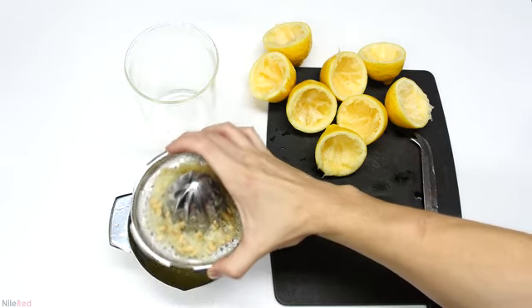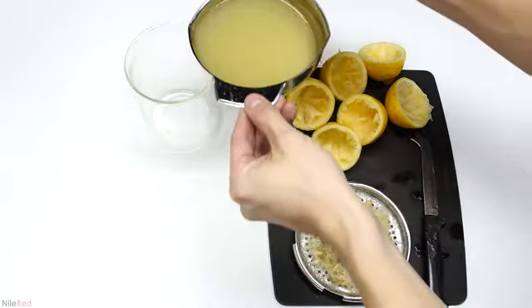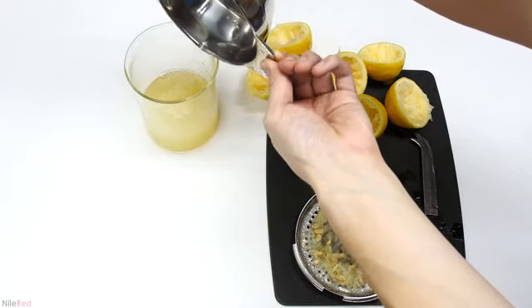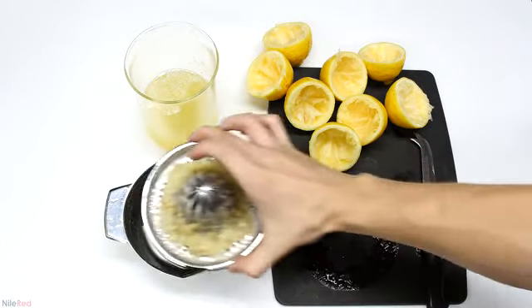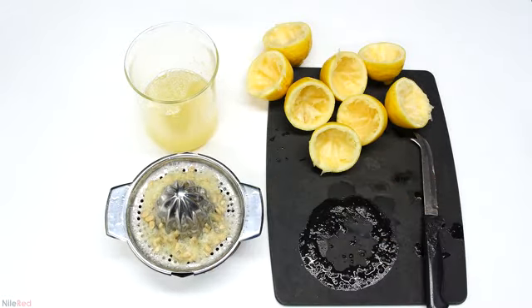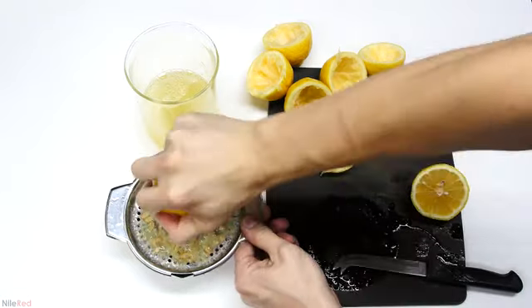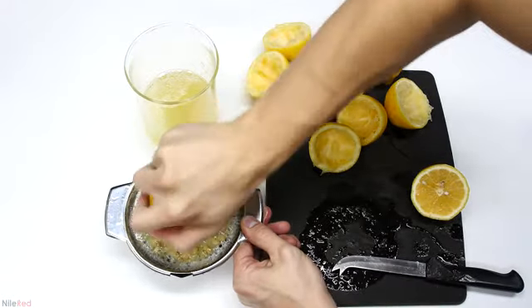Citric acid was historically produced by extracting it from fruits, but nowadays it's produced using a fungus. In the presence of a carbohydrate, the fungus will efficiently and cleanly produce citric acid. This process is very similar to the production of alcohol using yeast. The citric acid that I extract in this video is not going to be the highest quality, and I'm mostly just doing this for fun.